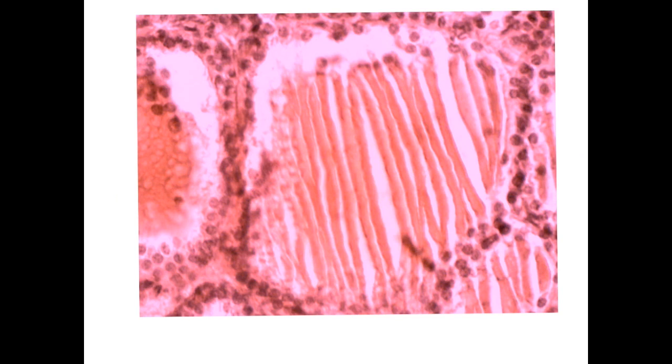A very nice high power slide. It is the thyroid follicle. Very easy to be diagnosed. This is, of course, the lining cells, which are cubical or cuboidal, and inside we have the most important feature, which is the acidophilic colloid inside. Most probably we have this shrinkage, which is an artifact, leaving these striations inside. But don't depend on that, because sometimes, as here on the left side, we have the homogeneous colloid. So it may be showing striation, it may be homogeneous. This is not important. The most important is an acidophilic material inside this follicle, which is lined by one row of cubical cells with the rounded nuclei, or cuboidal cells with the rounded nuclei.